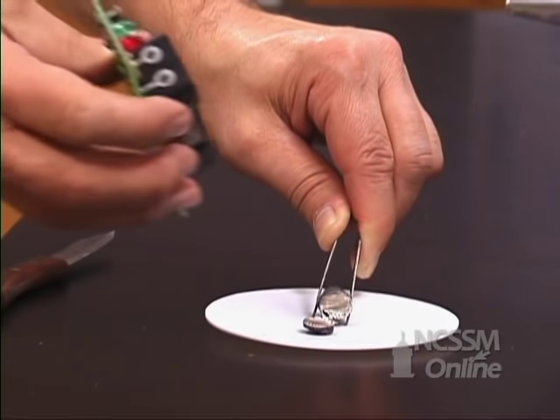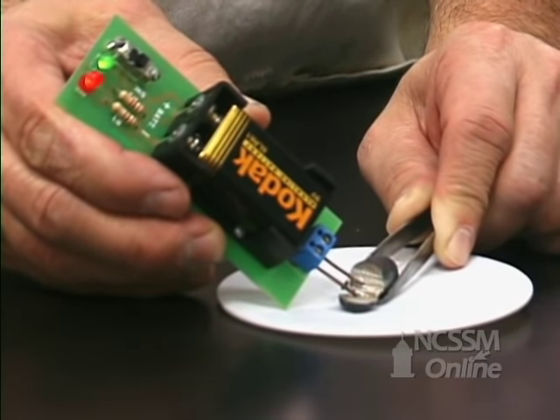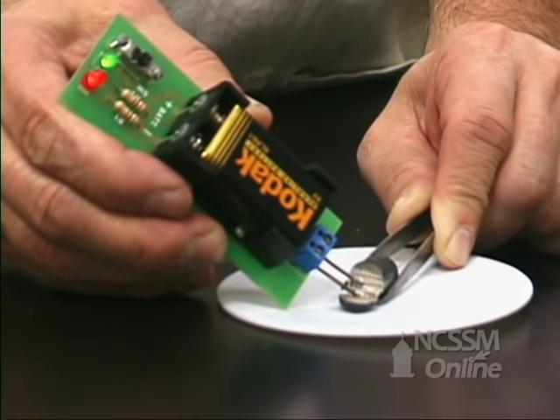If we bring in a conductivity tester, we can see that the lithium is an excellent conductor of electricity.